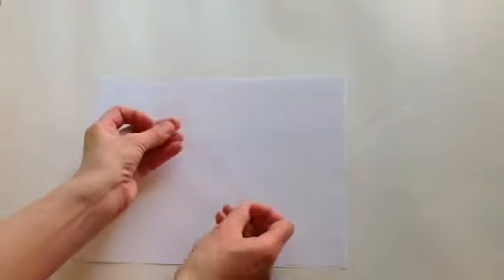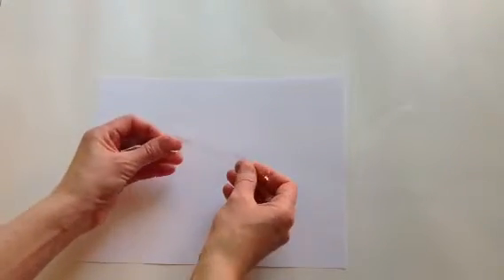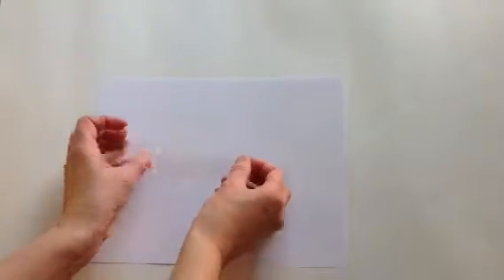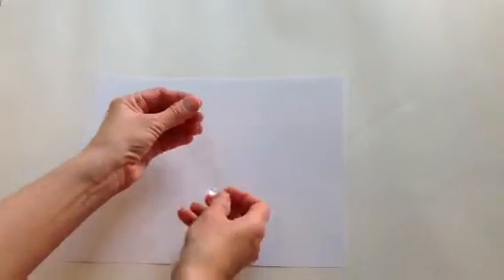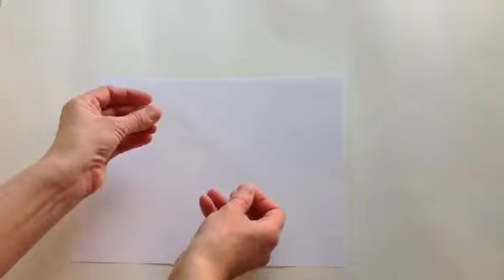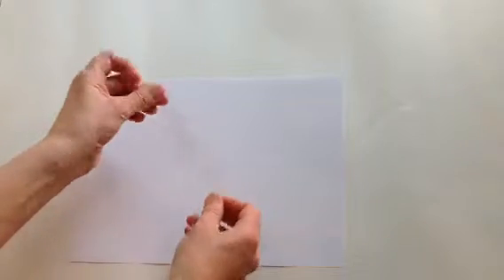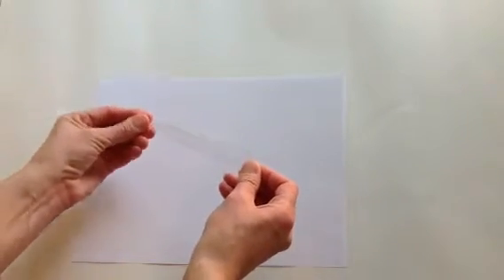Now, it may not look like it, but while this feels like and looks like a piece of cellophane, it actually is a tube. It's open at this end and it's also open at the other end. And in order for us to actually open this up and fill this tube, we will need to get it wet.